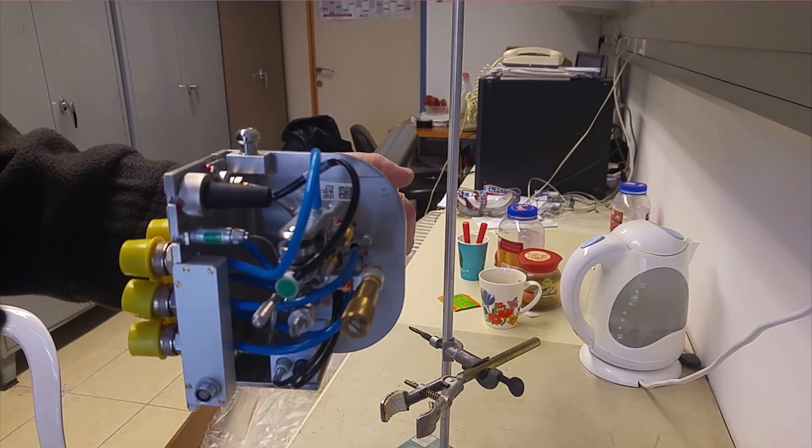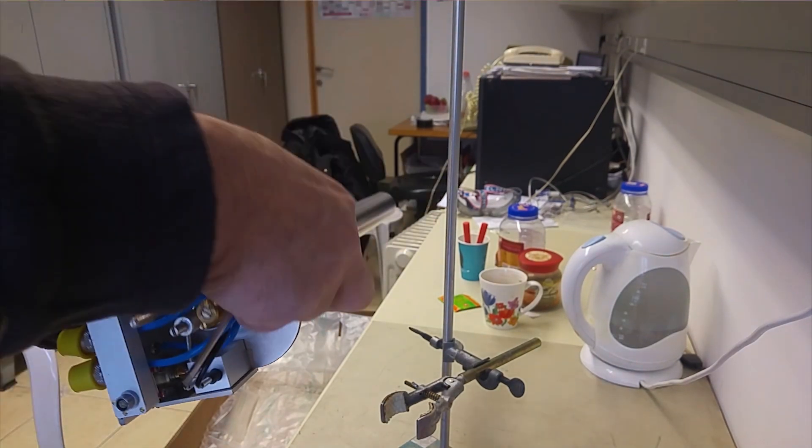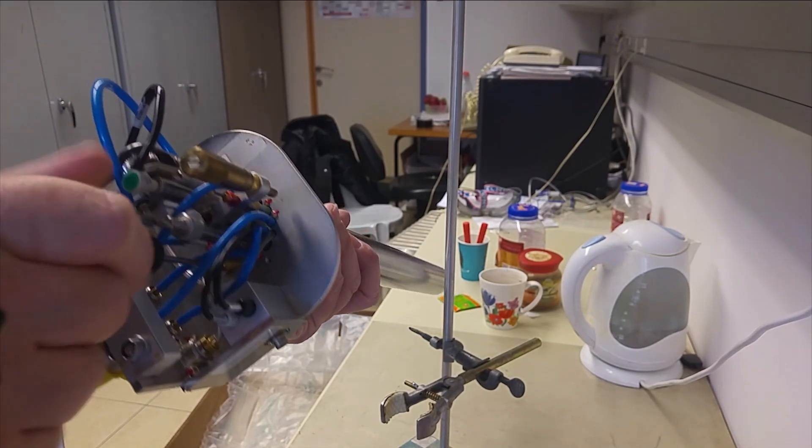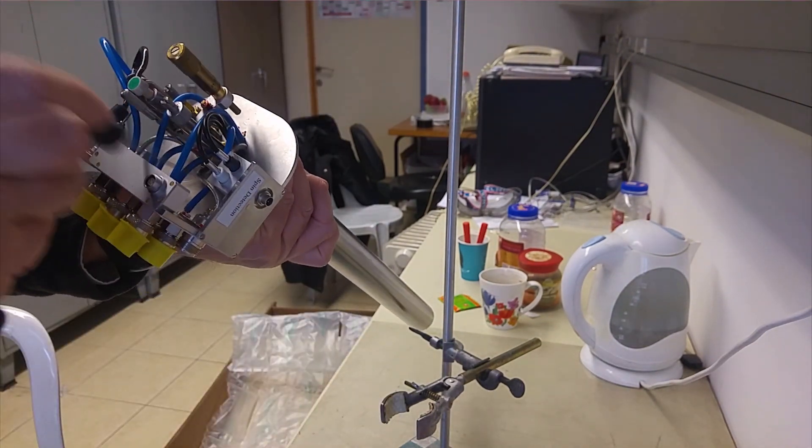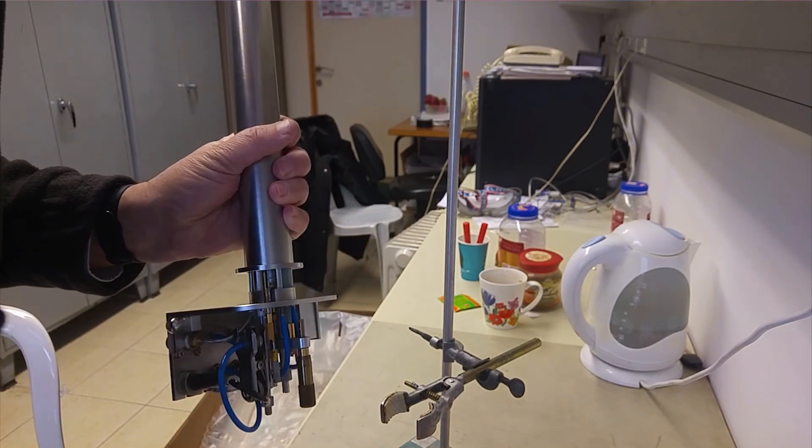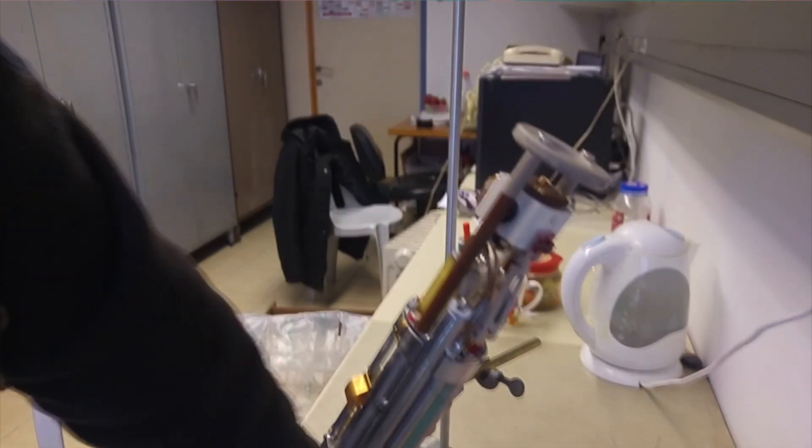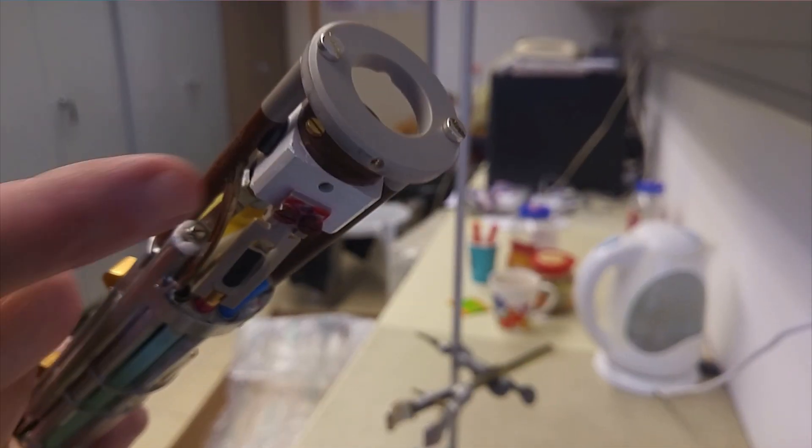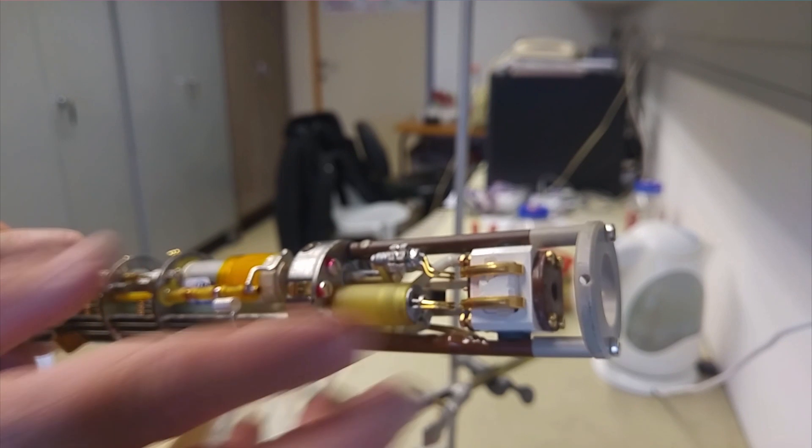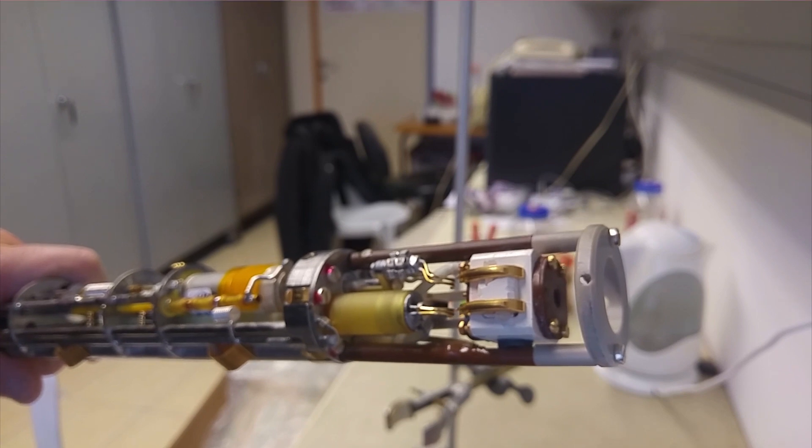The first step is to remove the screws in the bottom and take the outer can off. There are two screws. The can just comes straight off like that, and you see the probe head here. This is the damaged stator. If you look carefully, you might even see a crack here, and the coil itself is badly damaged.